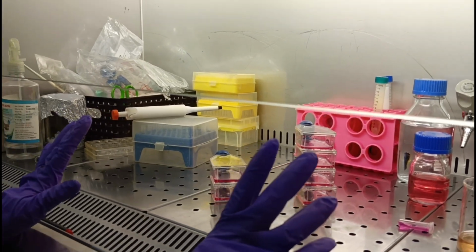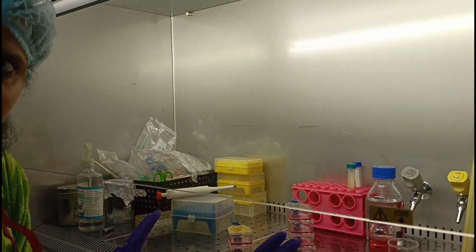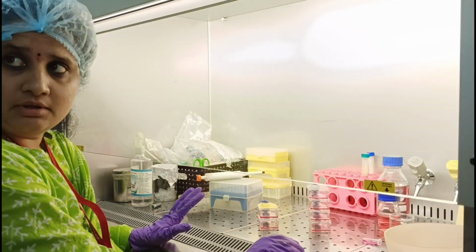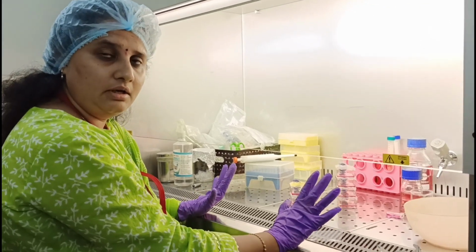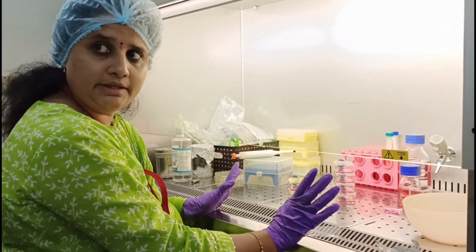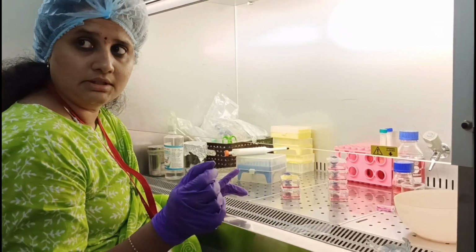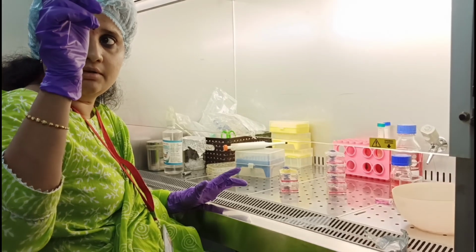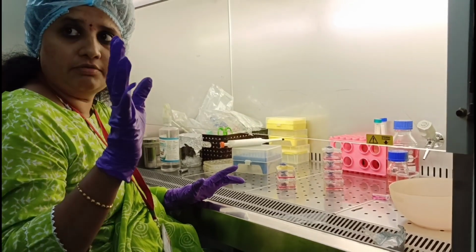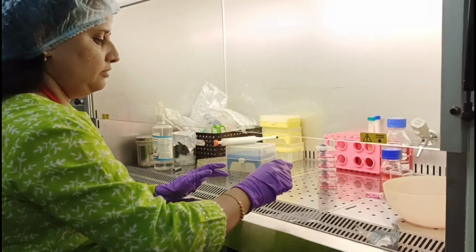Now altogether 6 are there. So if you see the cells, very few cells will be there, and they are round in shape now. They will be round in shape. So tomorrow if you see, if they are healthy, they will definitely attain their shape, like in the morning, in the beginning, how you have seen the cells. Now you have seen, with fewer cells, you can see the even distribution. You can see the cells.